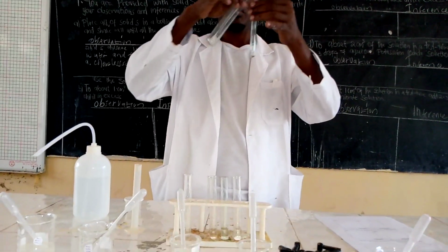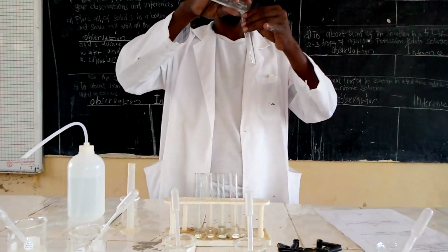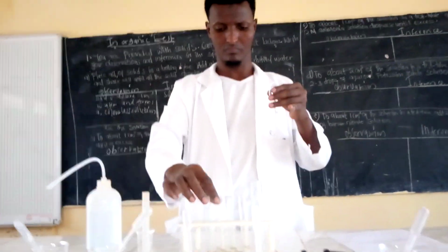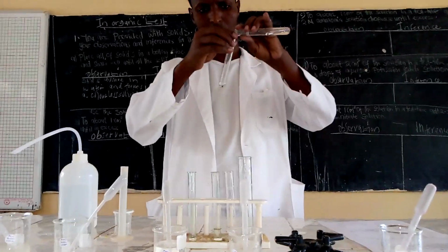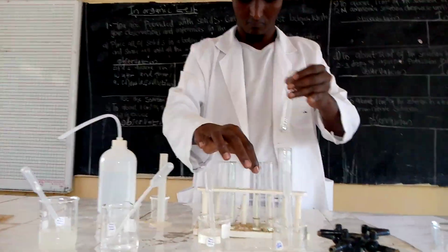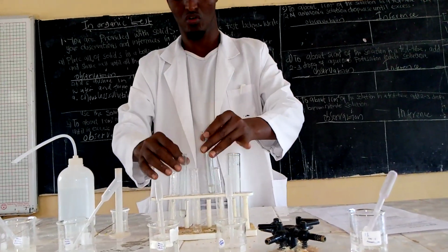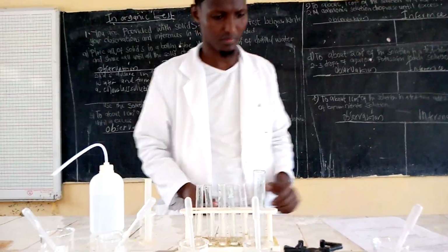Now I have divided it into 5 test tubes. Good.